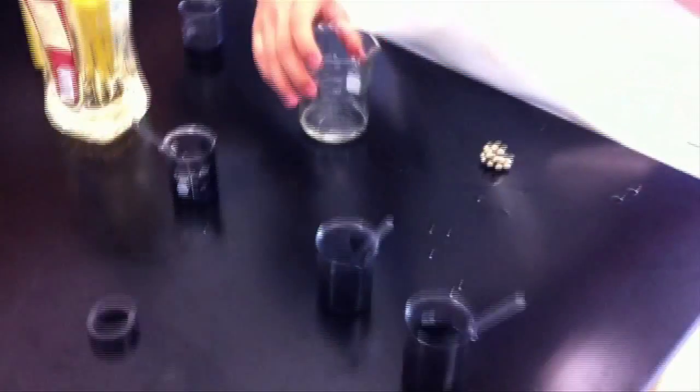Eventually, we went back to the simpler way of making ferrofluid by adding toner, a magnetic ink, to oil.